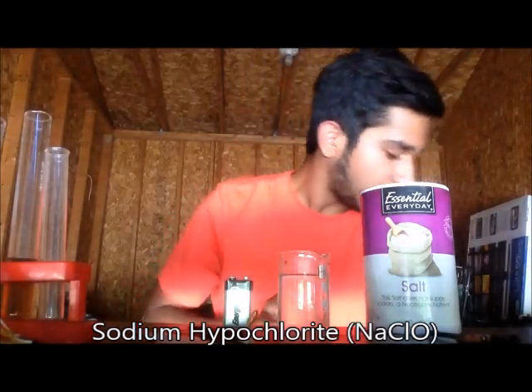Hi guys, I'm back with another chemical synthesis video. Today I'm going to make sodium hypochlorite, which is the same as household bleach. I'll be using table salt, or sodium chloride, to get sodium hypochlorite through the process of electrolysis of sodium chloride.